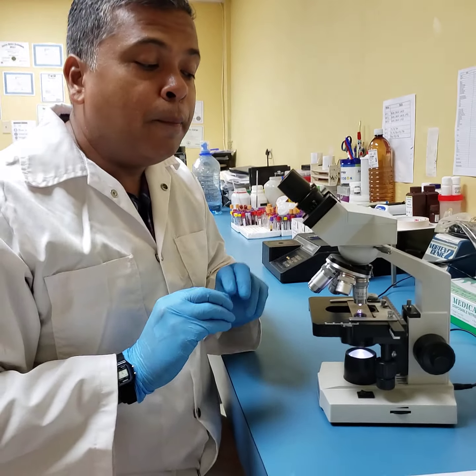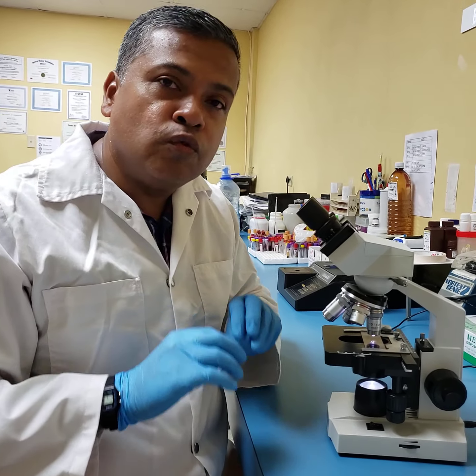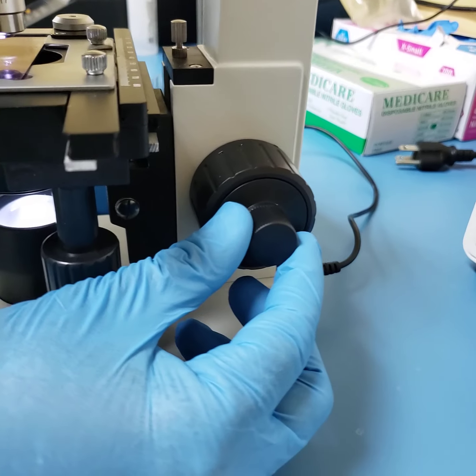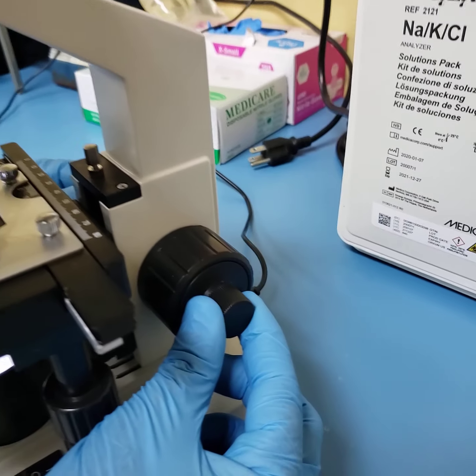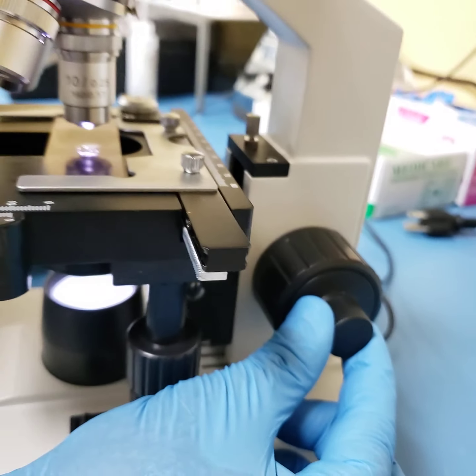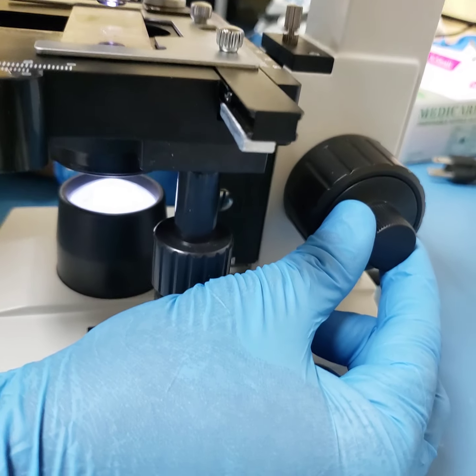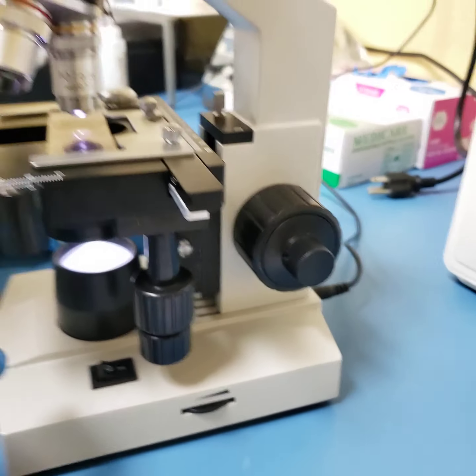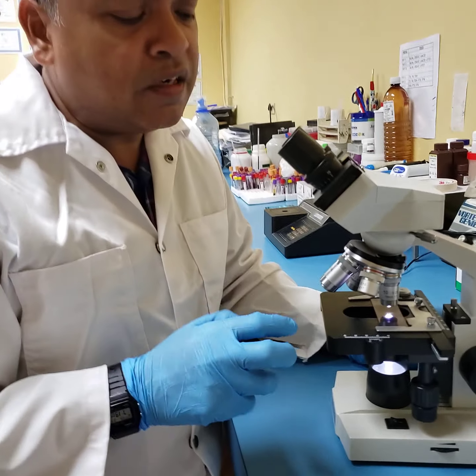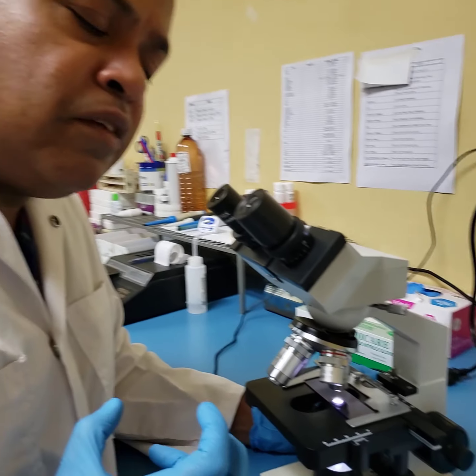All we are doing now, because of the parfocal nature of the microscope, is only using the fine adjustment knob, which is this little knob on the outside. This knob here, and why we call it a fine focus, is because a little turn in either direction is going to bring our image into a clearer, crisper appearance. So I have just adjusted my fine adjustment knob, and we have now increased the magnification from 10 by 4, which is 40, to 10 by 10. The image is now magnified 100 times.